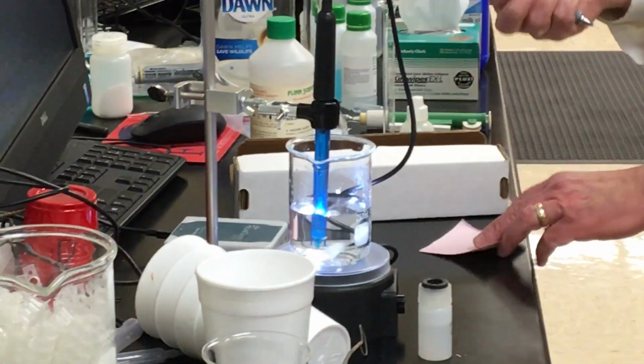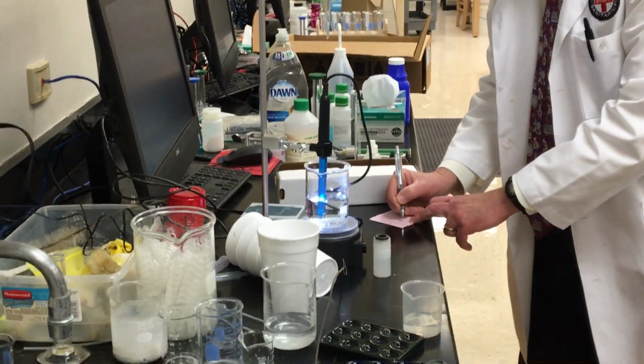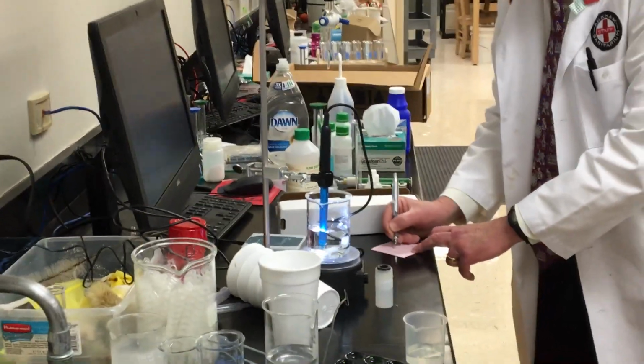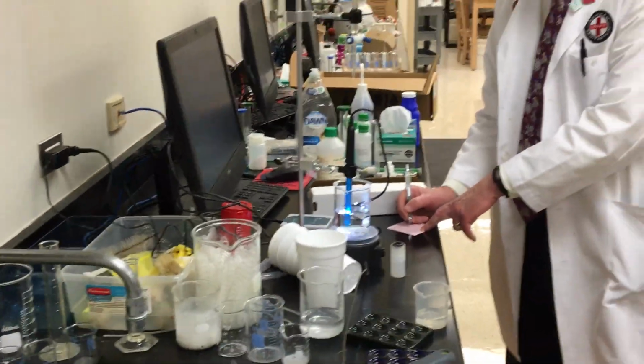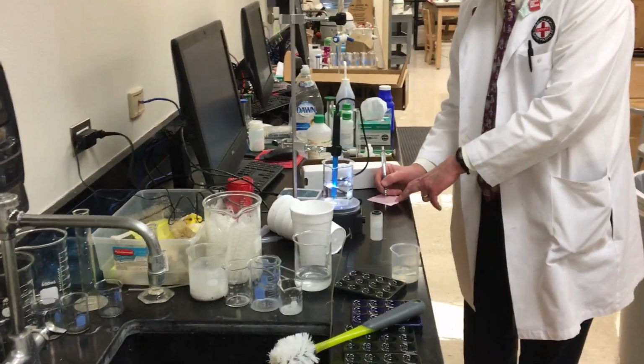You mean double tap on? It doesn't work like that. That's taking a picture. Concentration is 1.7. I can't flip it. Unless you want me to turn it around. 1.72 or 0.172? I'm not sure. I was messing with Jackson. Okay.